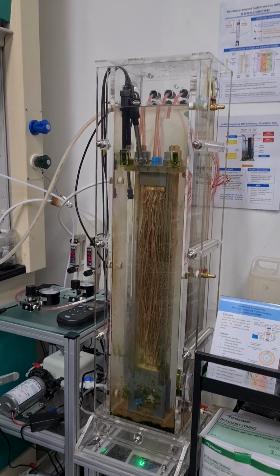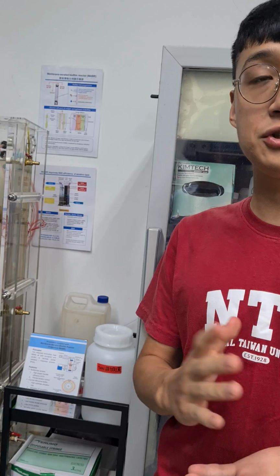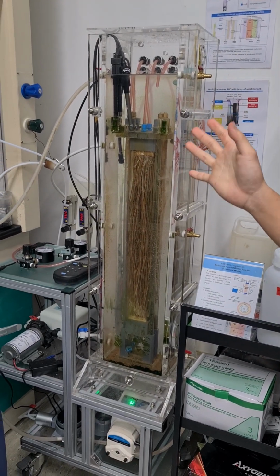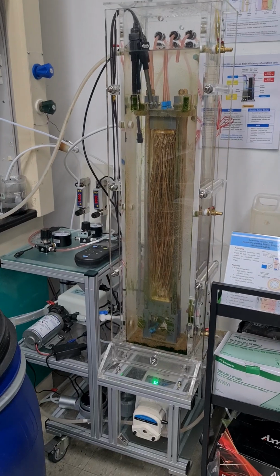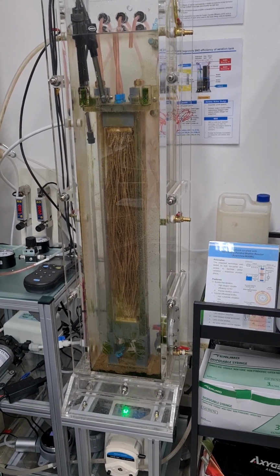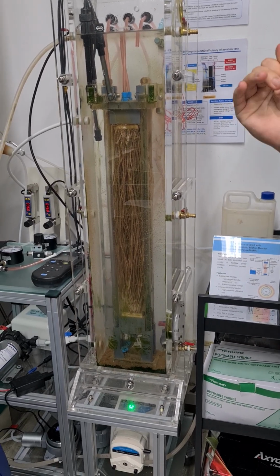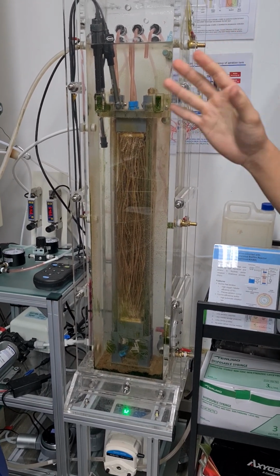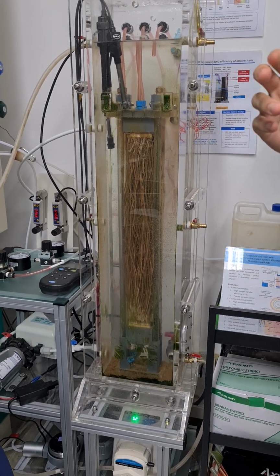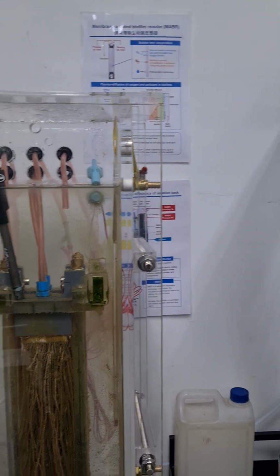Okay, just like Cindy already introduced to you, the process of PNA, partial nitritation, and Anammox process. So we want to apply this process with MABR technology. In this case, since we also focus on nitrogen removal, we haven't gone to nitrogen recovery. But in this way, we want to use the advantage of MABR to facilitate the PNA process, since we can control the aeration of the MABR module. And also this tank is maintained in an anoxic state.